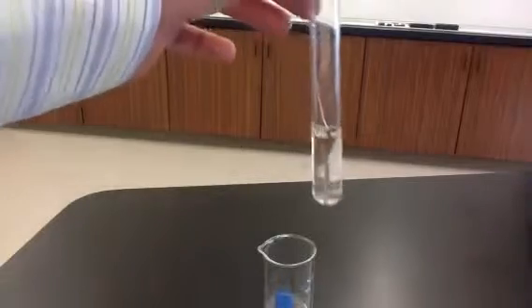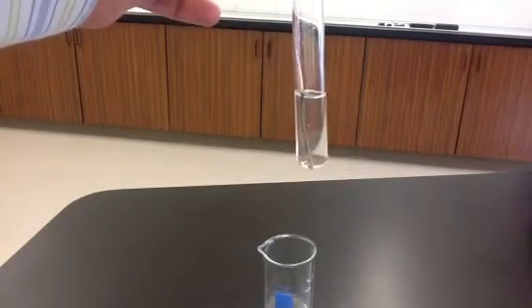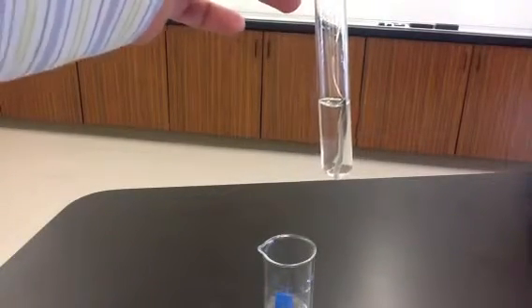And you can see this one starting to get even larger than when we first started it. If I waited another 20 minutes, it would be like the one I just showed you.